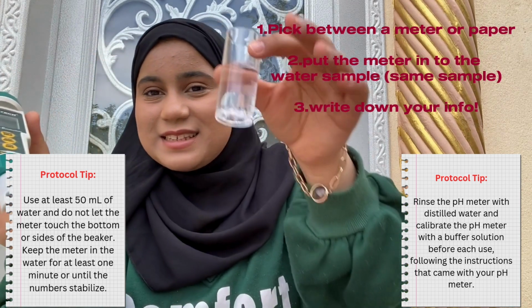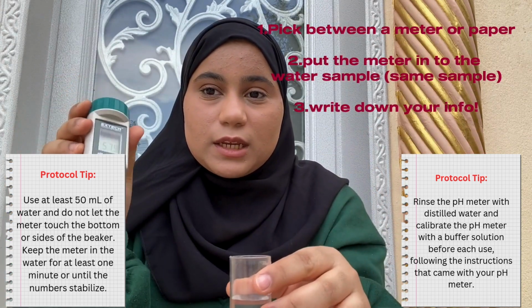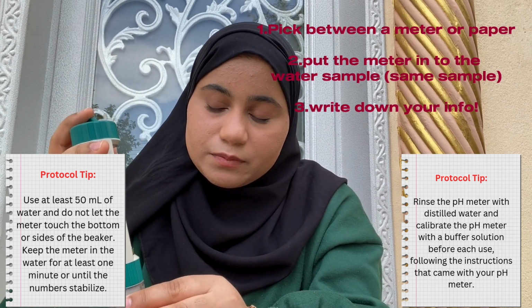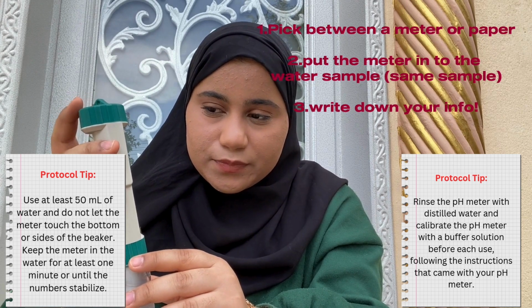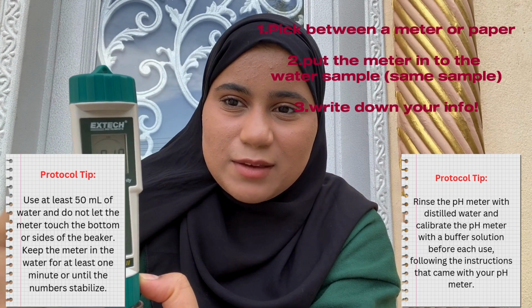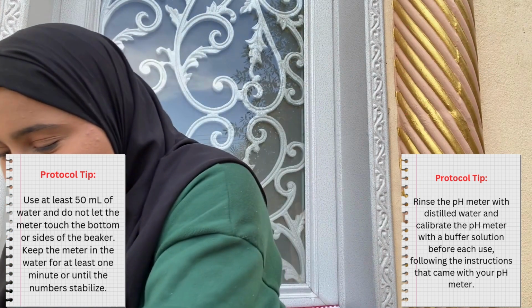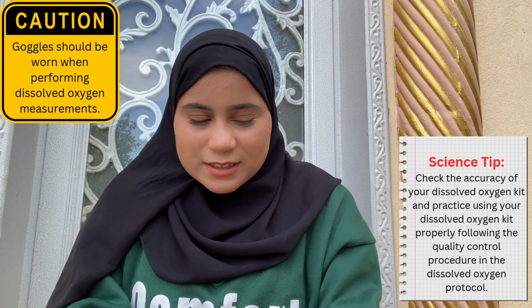We are going to get the same sample of the water, same sample, don't change it. Then we're going to get the pH meter, and you're just going to stick it in there and wait for the pH. 8.19. We're going to keep it like that. So 8.19.